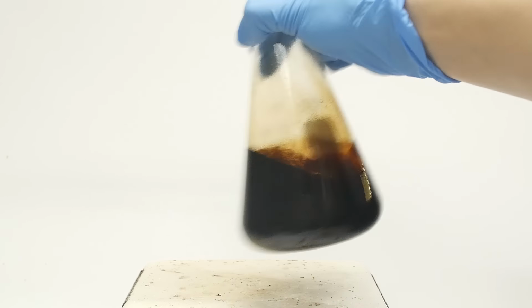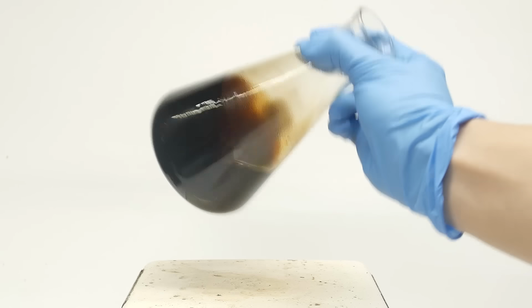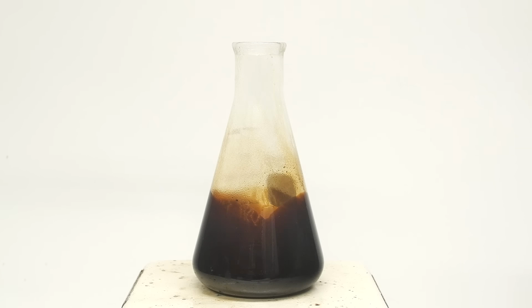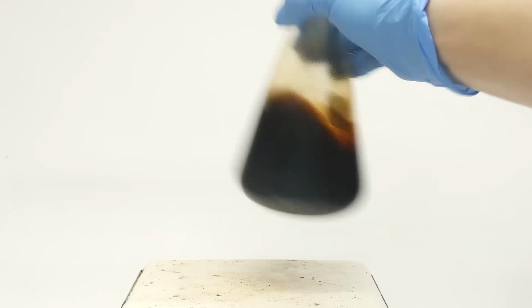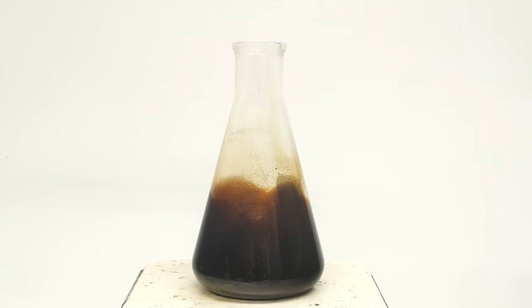This was really promising for me because I started out with fatty acids that were solid at room temperature, but now I have a liquid even at refrigerator temperatures. So at the very least, some sort of chemical reaction has occurred. To find out if I've actually made any triglycerides though, I'm gonna have to process it a little.